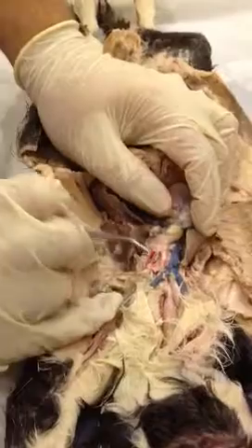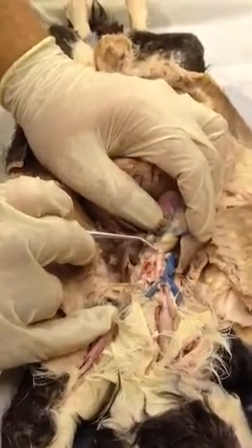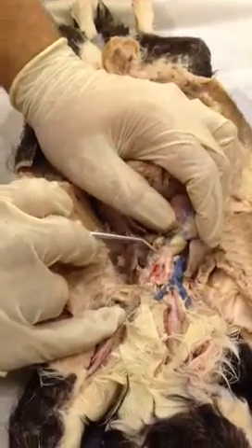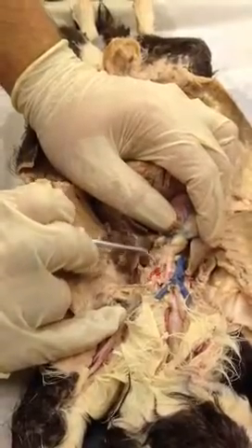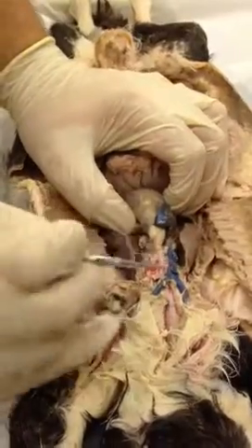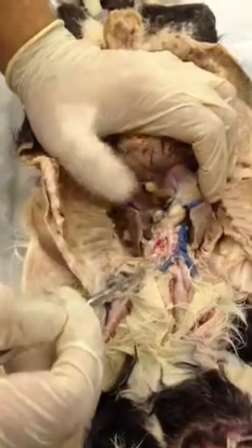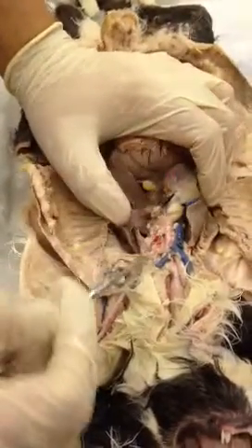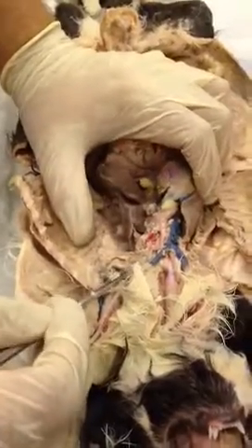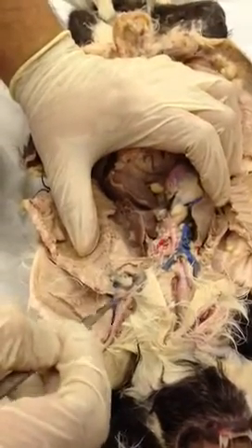The aortic arch is going to have a few branches off of it, which, it's college football season, BCS, which stands for the brachiocephalic. Yeah. And this is our left subclavian coming up over here. Here we can see the anterior vena cava in the cat. In blue. So if we follow the brachiocephalic, or left subclavian, which one is going to feed into the arm? Brachiocephalic. All right. Are we sure? Isn't it subclavian? Subclavian, right? Yeah. It's going to be a subclavian.